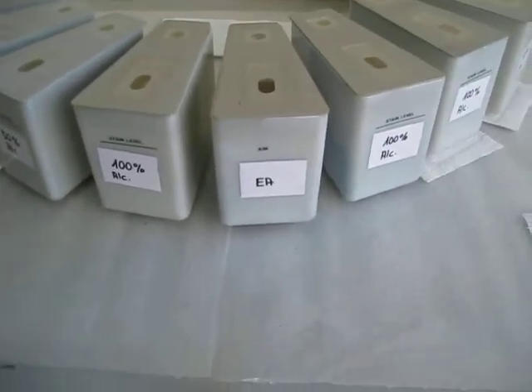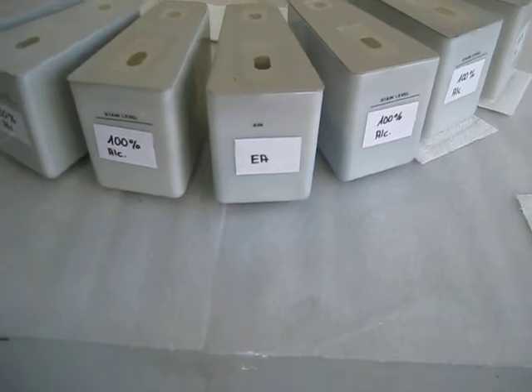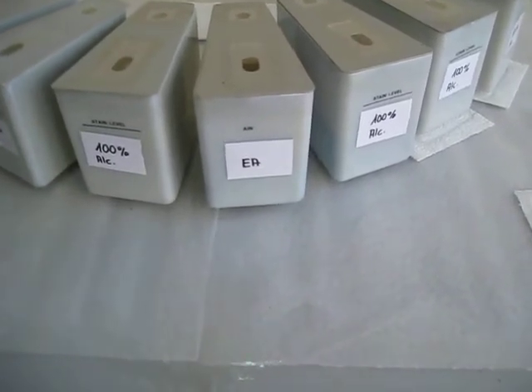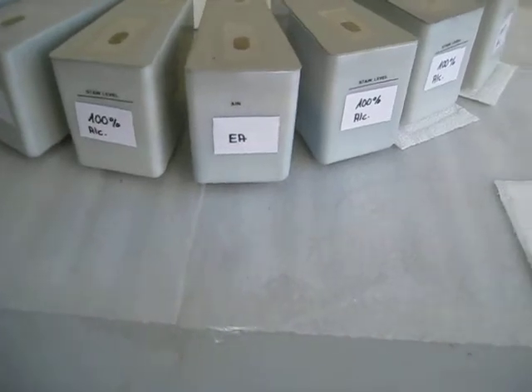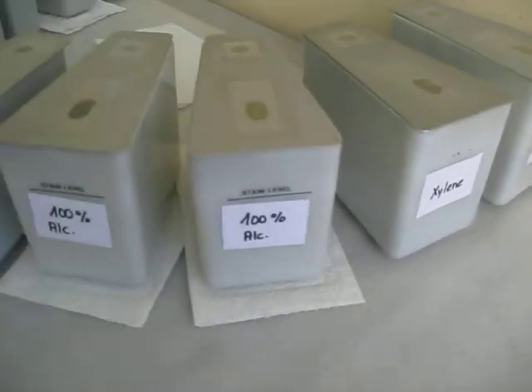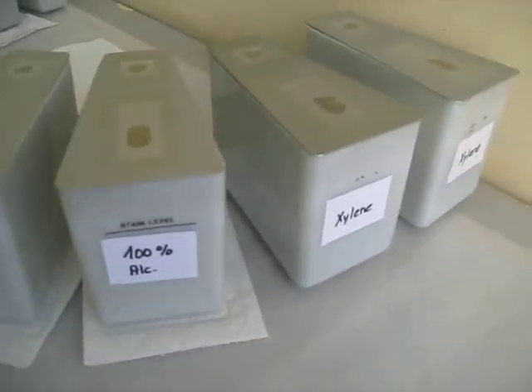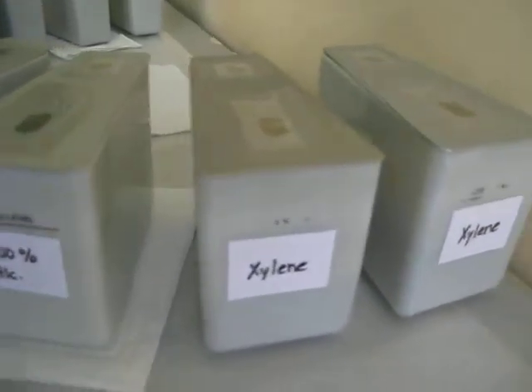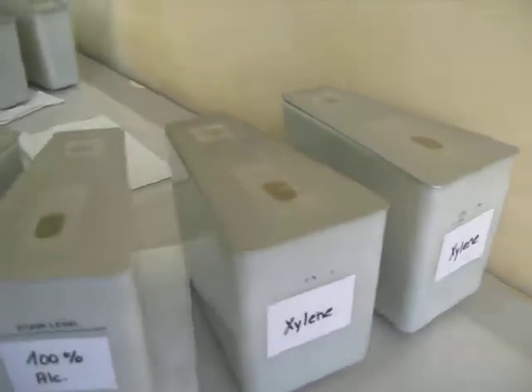Then you come to eosin, where the slide stays for up to five to ten minutes. After that you have three changes of 100% alcohol — the alcohols ensure there is no water remaining before you go into the xylene. Then you have two changes of xylene.